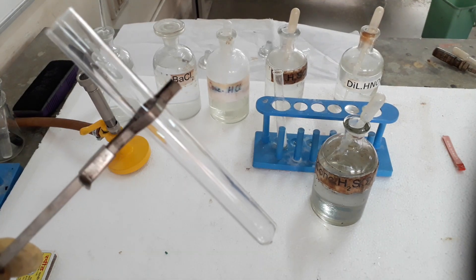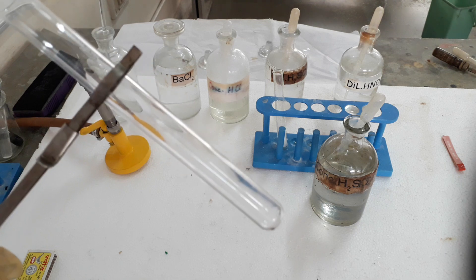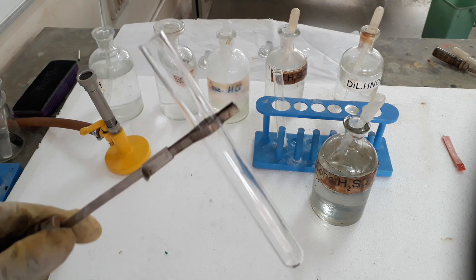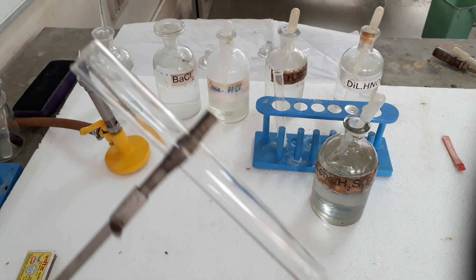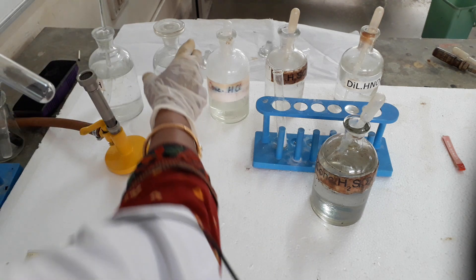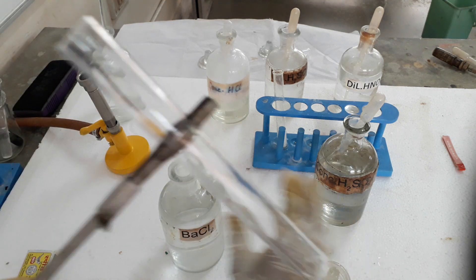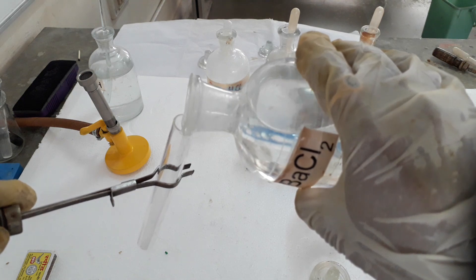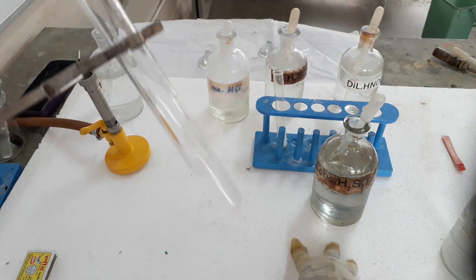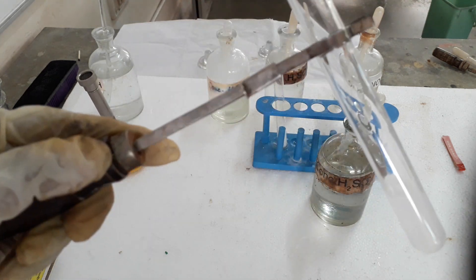Hello students. Today I will be explaining how to test sulfuric acid. To test dilute sulfuric acid, we take barium chloride solution. I have taken a little amount of barium chloride solution here, which is a transparent solution.